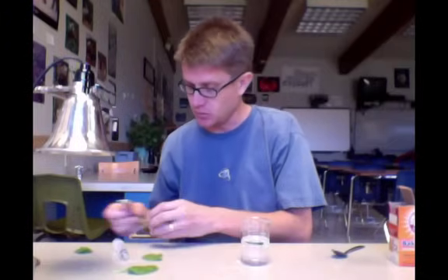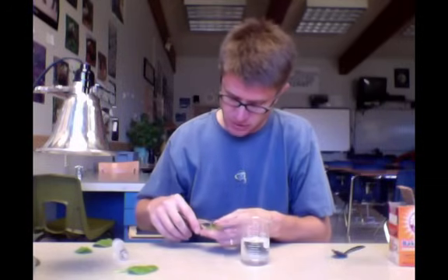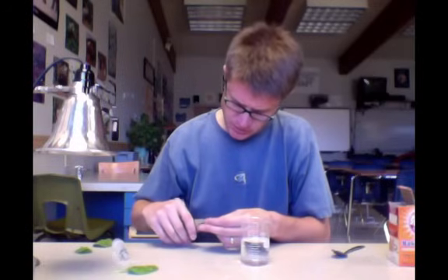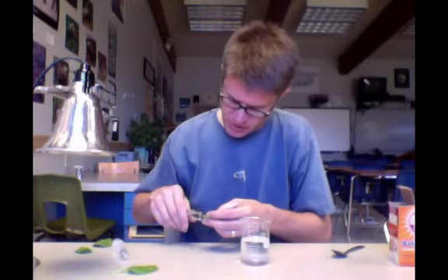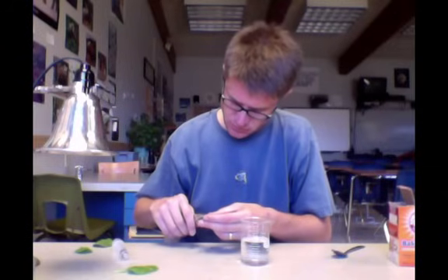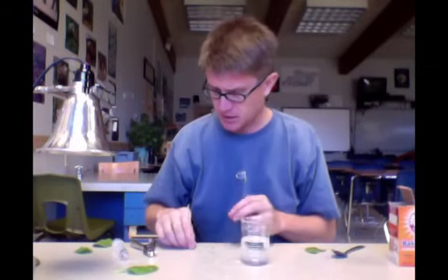The first thing you want to do is get your leaves. To get your leaves you're going to use your hole punch and you're going to punch them out of the leaf. You want to try to get ones that are between the veins. You can punch a whole bunch of these out. I'm just going to do a few. In one beaker you could put 20 leaf chads inside there.